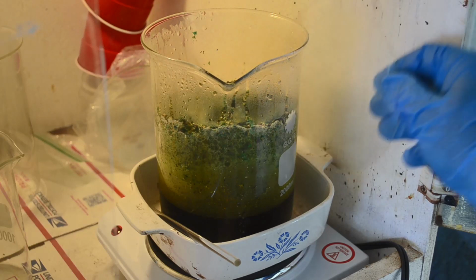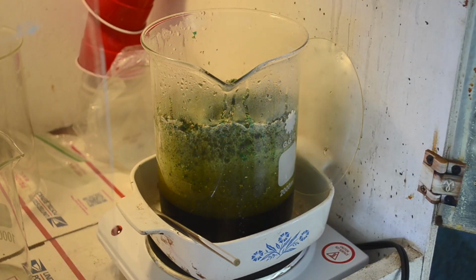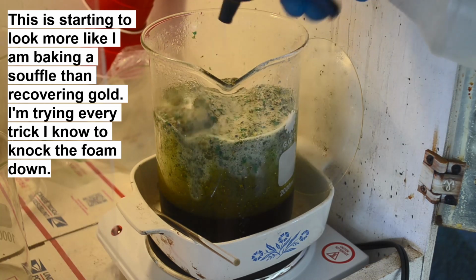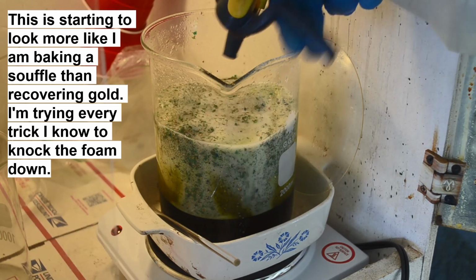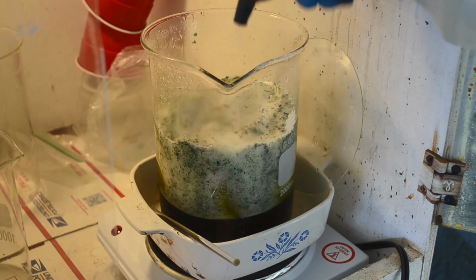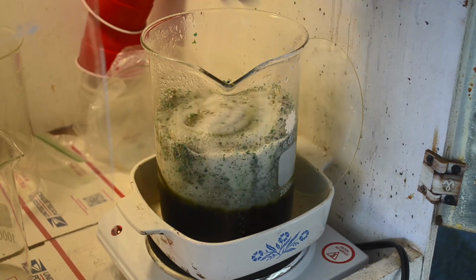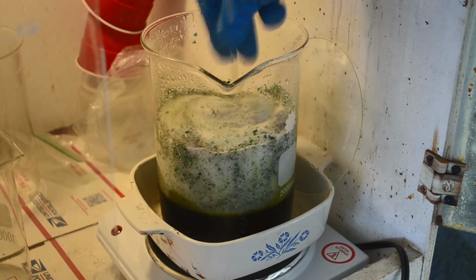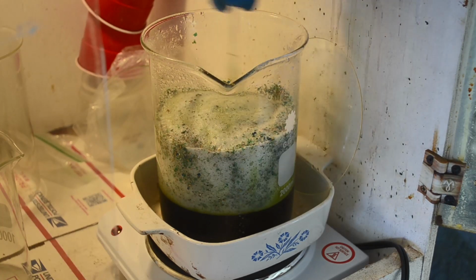I think what's happening is as the gold foils react with the aqua regia, we're producing nitrogen dioxide gas, and this pudding-like stuff in here is just inflating with the gas. I can knock it down some here. I can see that this is not going to work on the large scale. It may not work on this scale. I don't know. And there's still a whole lot of gold foils in here that have not reacted yet. I can see them down here in the dark green liquid as I stir it, and I can see them embedded in the foam up here.